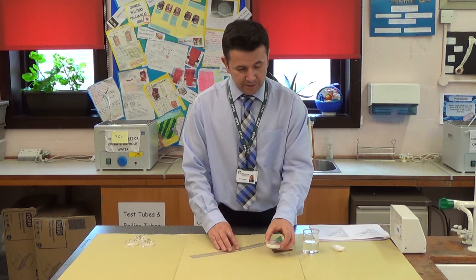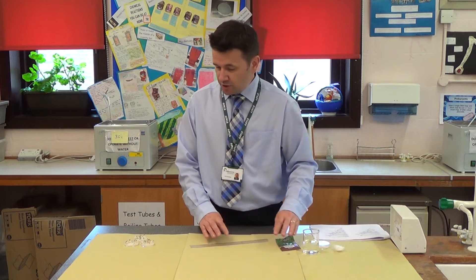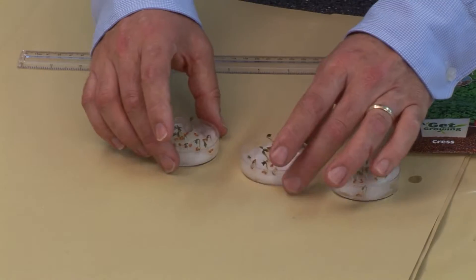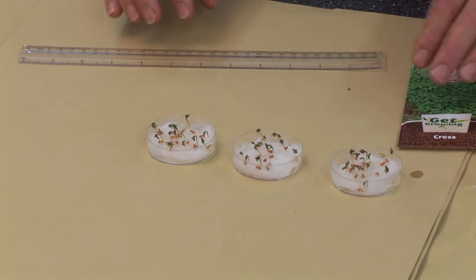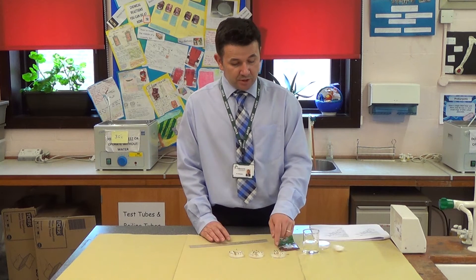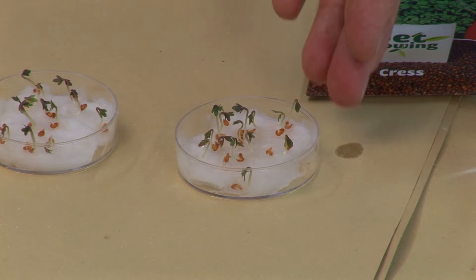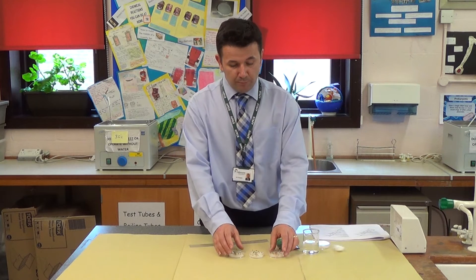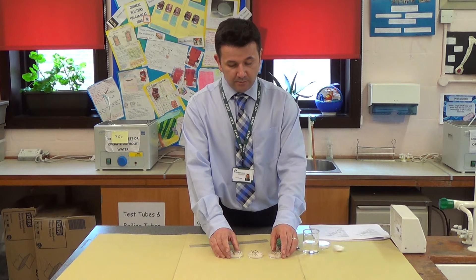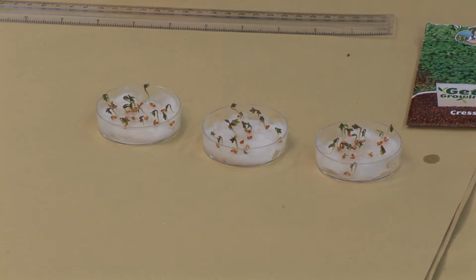I've done that three times, so I've got three Petri dishes here and I've allowed these to germinate — germinate means basically for the seedlings to start to grow. These have all been on a lit windowsill and now they're ready for the experiment.